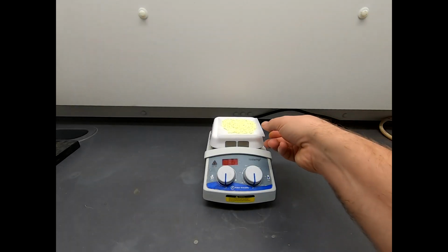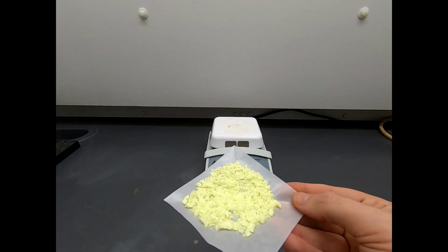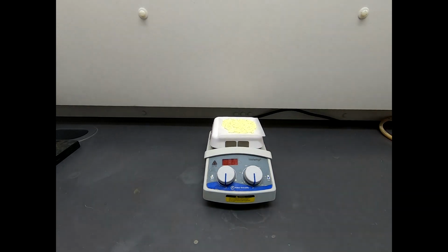It is now a day later, and here is our dry material. This is 3.377 grams of recrystallized product, that is benzil, formed by the oxidation of benzoin. And that's going to be a pretty good yield. Of course, anytime you want to talk about the yield, you have to talk about purity, and the characterization data will either back up my claims that this is clean, or it'll undermine my claim. So we'll just have to see what the characterization data say.